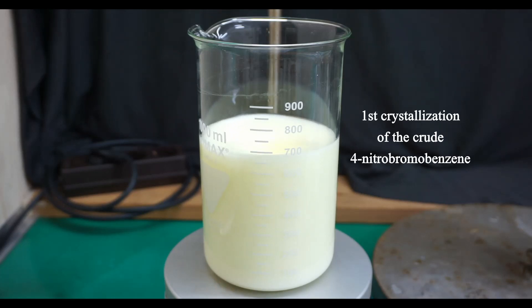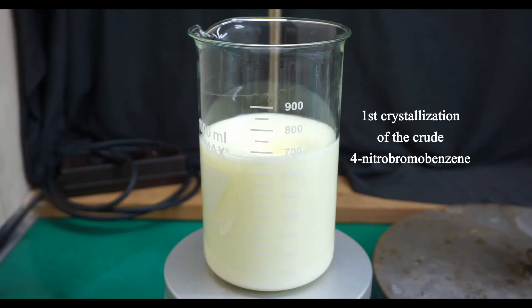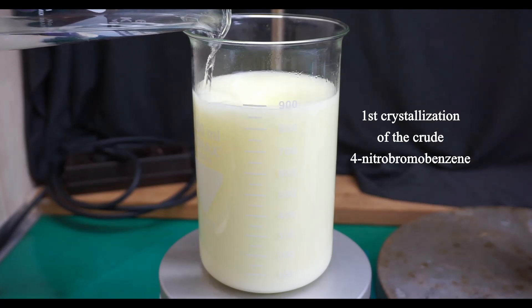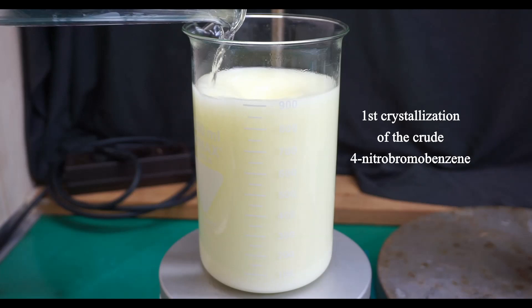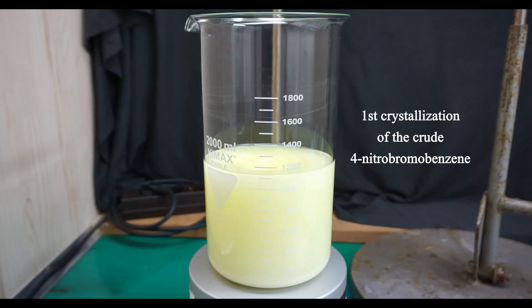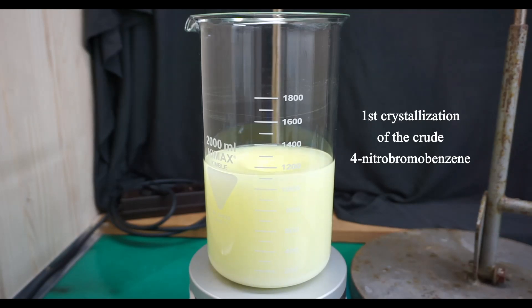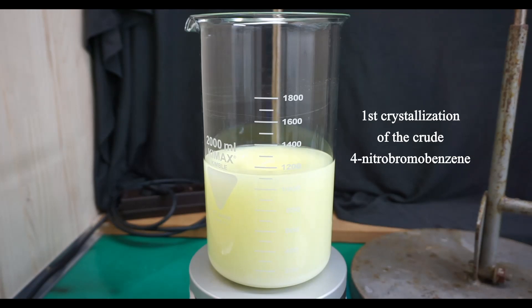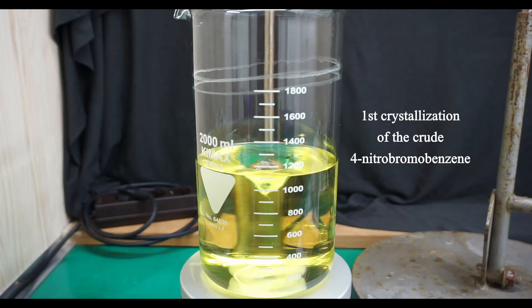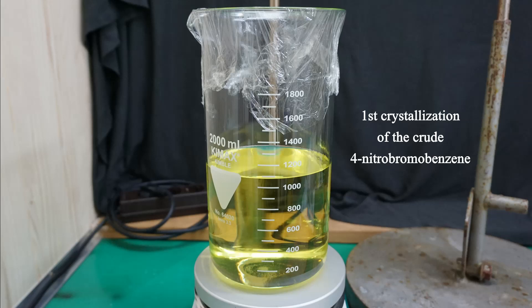I transferred the damp solids into a 1-liter beaker and began dissolving them in 96% ethanol. I heated the suspension to boiling and kept adding 96% ethanol until all of the solids dissolved. It turned out that the 1-liter beaker wasn't big enough and I had to transfer the content to a larger 2-liter beaker. I ended up using approximately 1070 ml of 96% ethanol to get everything to dissolve. I ended up with a nice yellow clear solution, then covered the beaker with plastic wrap and left it standing at room temperature overnight.